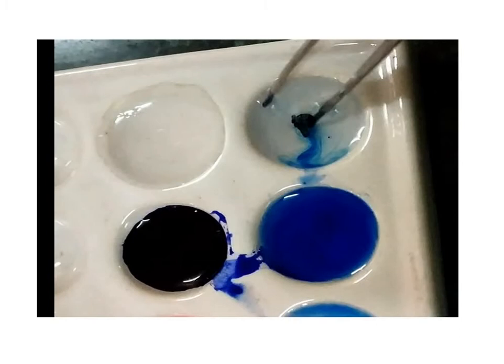Regarding the double staining process, using forceps we gently transfer the sections into a small petri dish or well, and immediately add a drop of safranin stain to cover the sample. Let the section sit in the stain for 3 minutes. After that, the stain is removed and 70% ethanol is added and it sits for 1 minute.